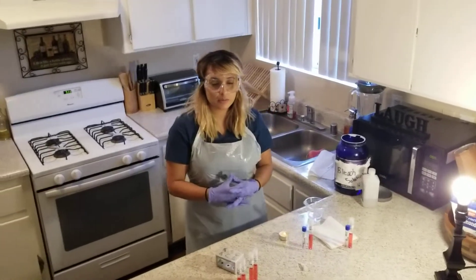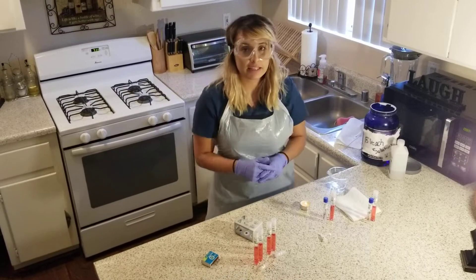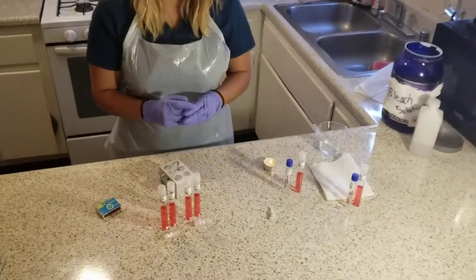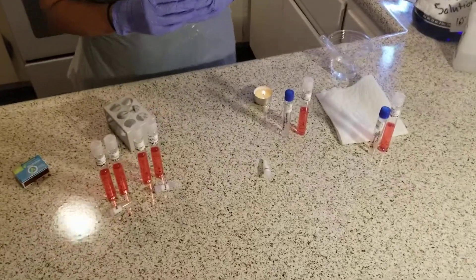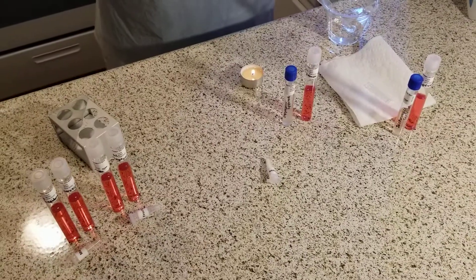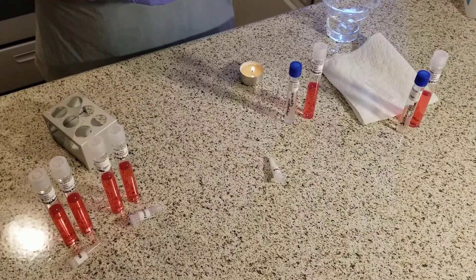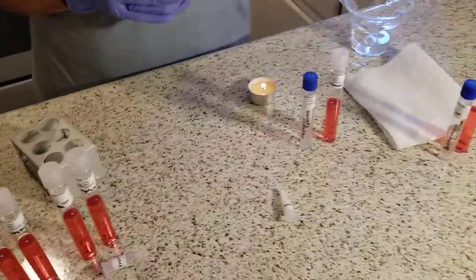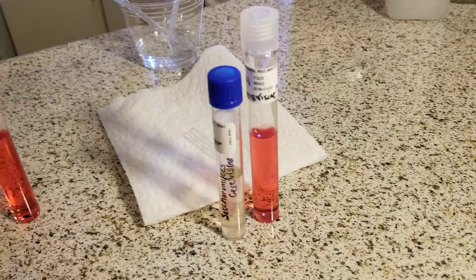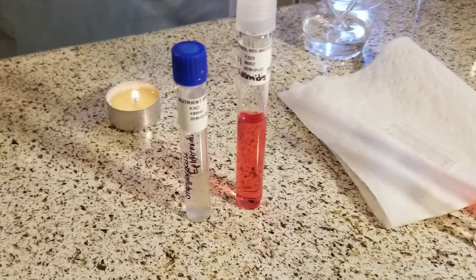Hi, my name is Alicia Cota. This is week 5 of Bio 225. Today's date is 6-6-2018. This lab experiment is going to be biochemical testing for microbial identification and carbohydrate fermentation testing. In this lab, I will incubate S. cerevisiae and S. epidermidis cultures in fructose, glucose, and mannitol broths to categorize each microbe based on metabolic properties.